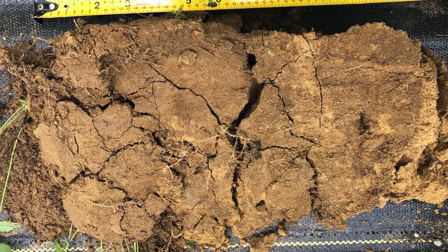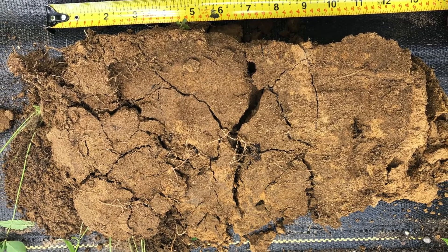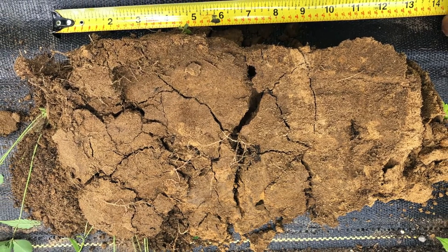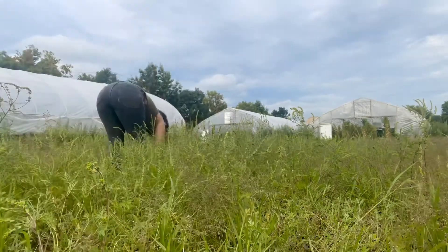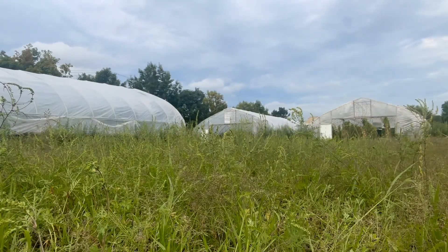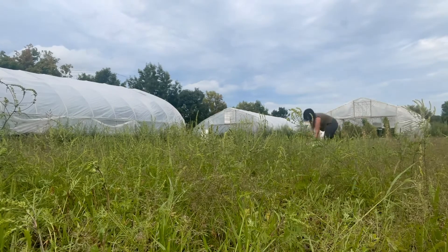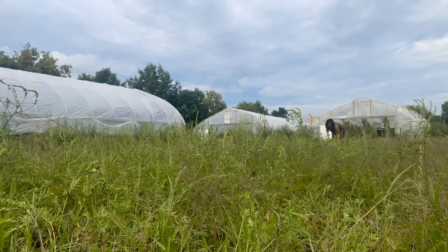For the Munsell soil color test, the microbiometer test, and soil respiration test, you'll gather multiple samples of your soil to represent the area that you're interested in. You'll mix them and take a sample from the mixture — also known as a composite sample. Each test has slightly different instructions regarding how many individual samples to take and different depths from which to sample. I'll go over these instructions while walking you through each test.